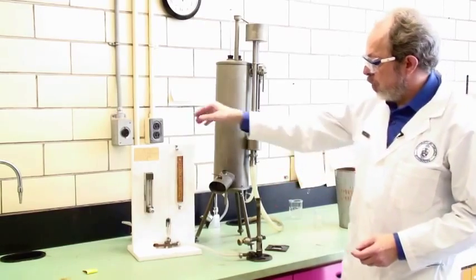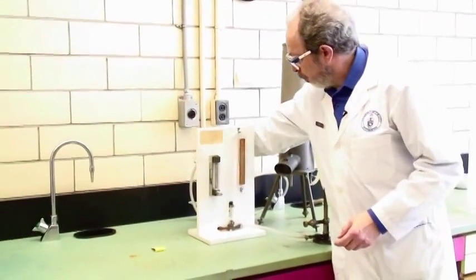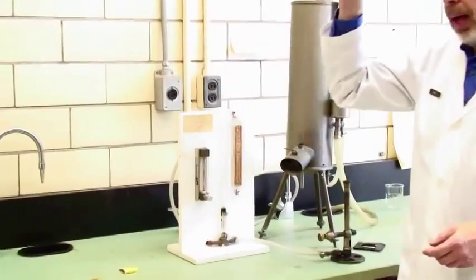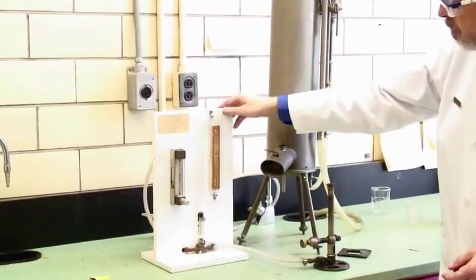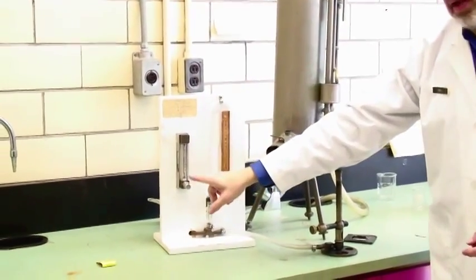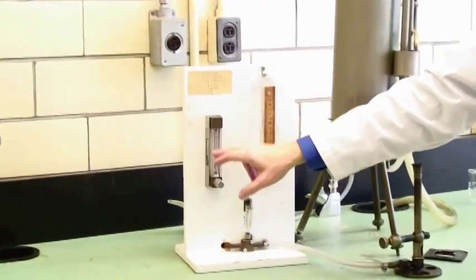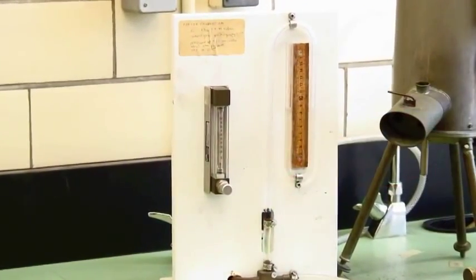The gas is controlled. There's a tap back here which turns it on. You will have to turn the gas on first but it is also controlled by a rotameter which is the control for how much gas is coming through.